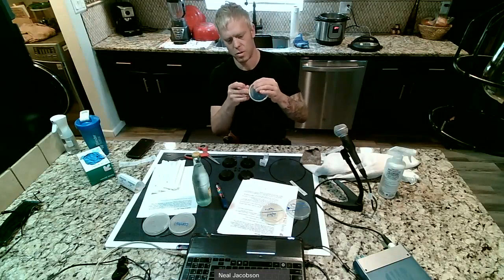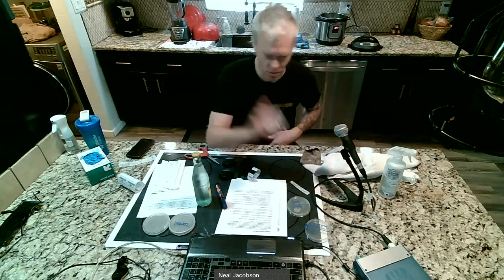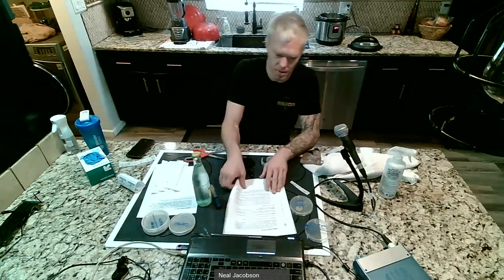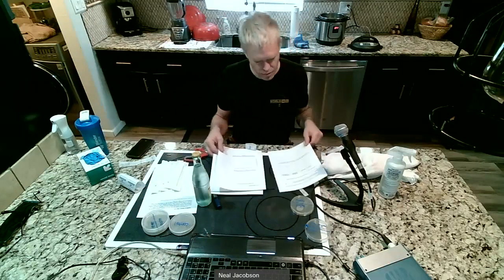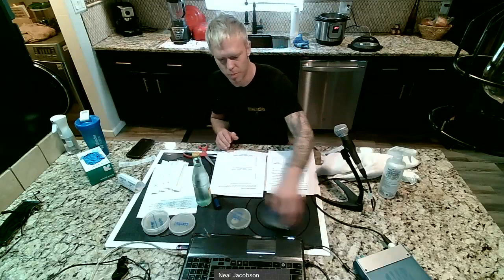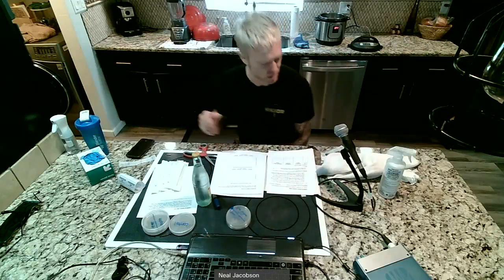And I am definitely gonna do all this. I promise you guys that. But I'm not gonna bore you with watching me swab different parts of my body. So do exactly what we just did for that. Make sure that you seal it up and tape it with your parafilm. And then after you're done with that, we'll skip to inanimate objects. So pause your video, go ahead and take care of that. I'll take care of those after I'm done talking to you guys.